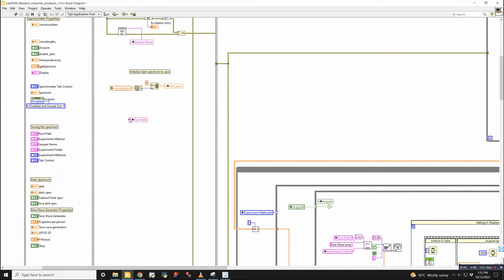So if the connecting terminal is on the left-hand side, information is flowing into it. So this is like an indicator, but you can change it to read, which makes it more of a control where you can take the information out of this variable. It's really nice to have that flexibility, because if I just have the variable sitting somewhere in the loop and I want to write to it, but it's a control, then I'm not going to be able to do that, because it will only let you read information or write information, but not both. The local variables give you that flexibility to do either of those.